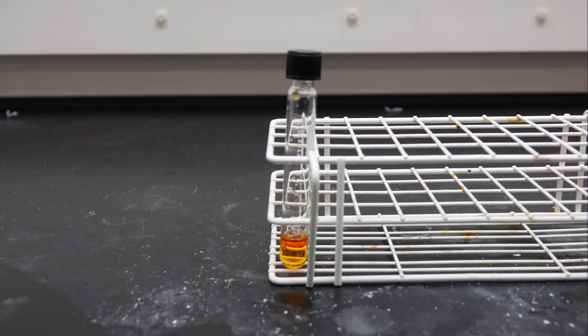What you should see is two distinct layers in your test tube: the oil layer and the water layer. The molecular halogen will be in the oil layer and the ionic halogen will be in the water layer. This is due to polarity.